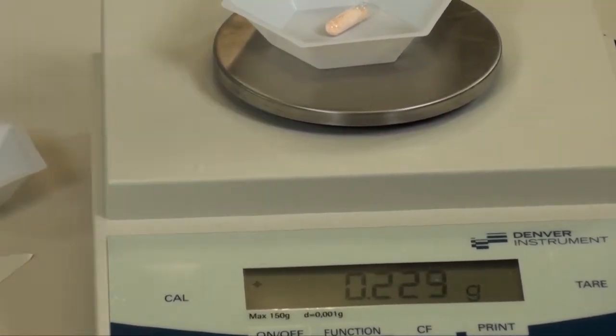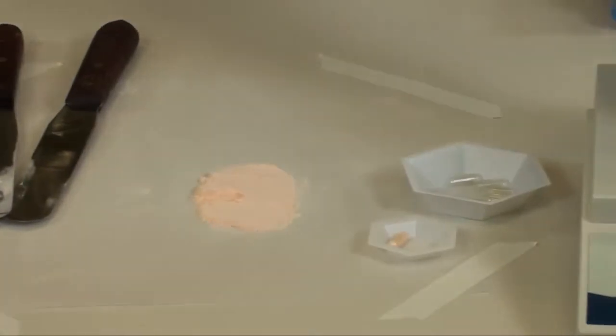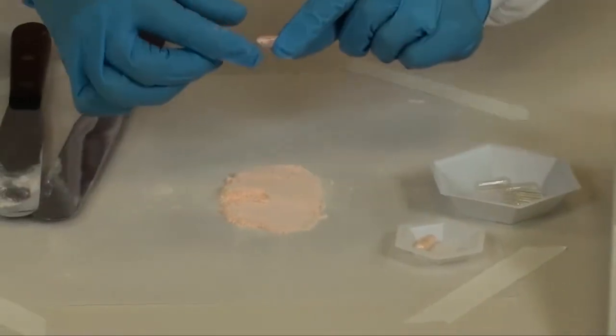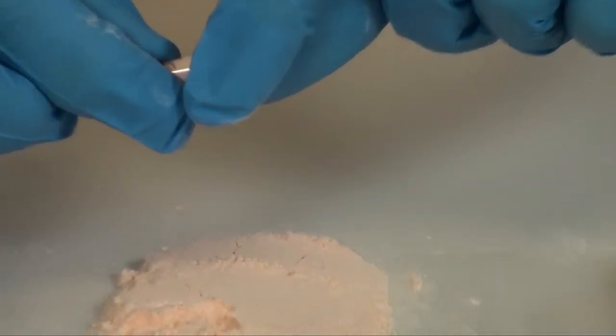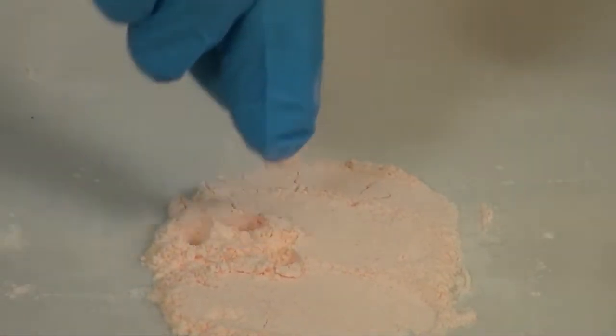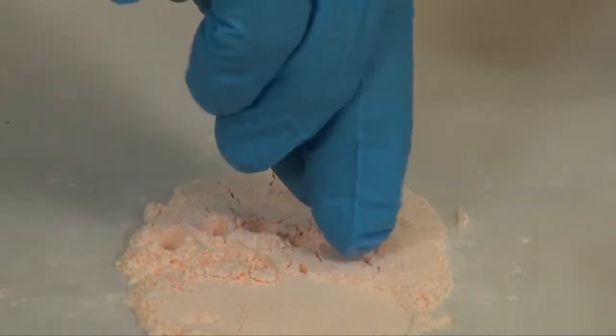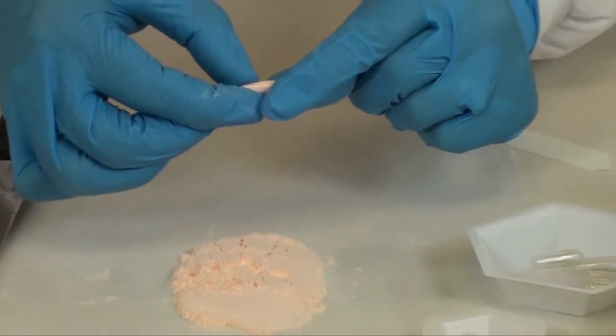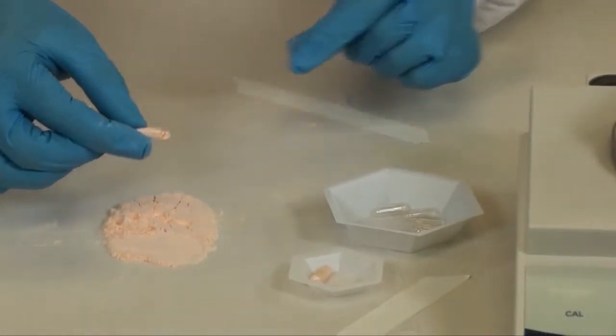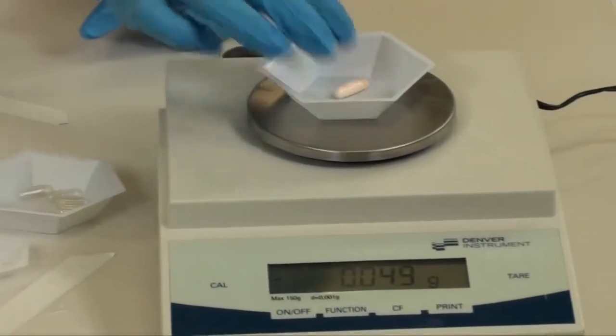It is too light, so we need to add additional powder. Remove the cap, go back into your powder bed, and punch until you have additional powder. Replace the cap and check for weight.